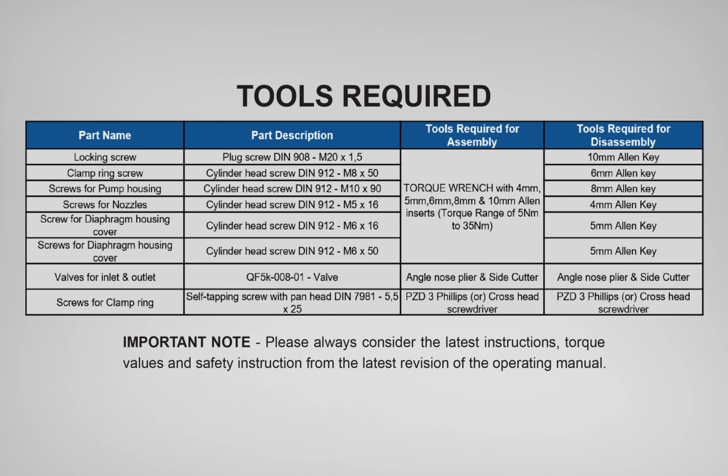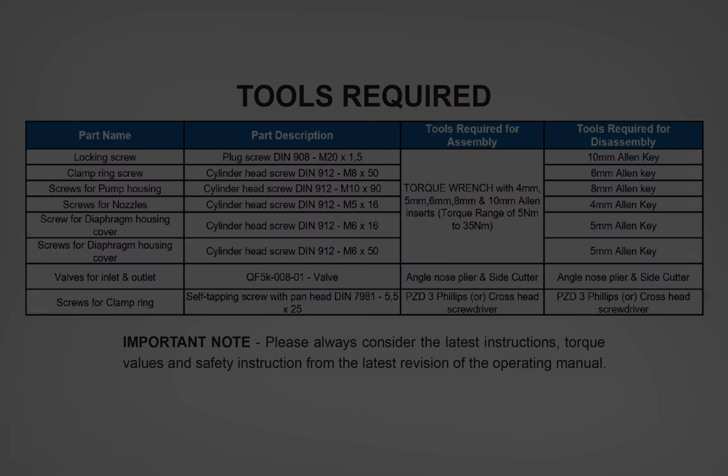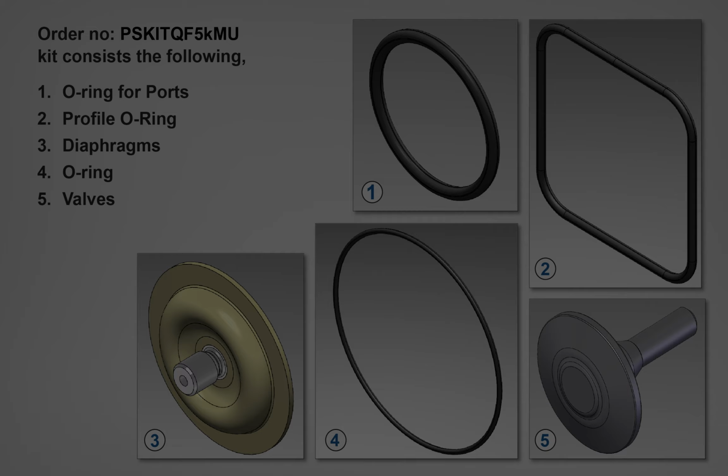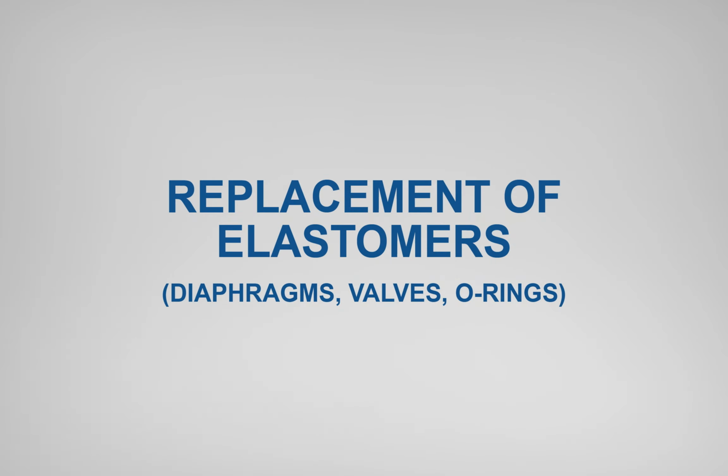The following tools are required for assembling and disassembling the pump. The following items are available in the kit. Replacement of elastomers, diaphragms, valves, O-rings.